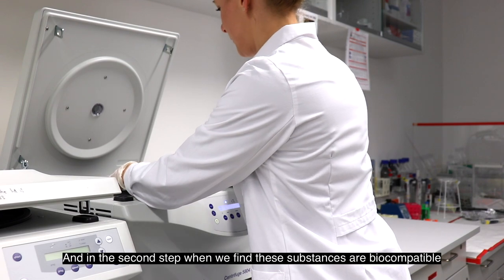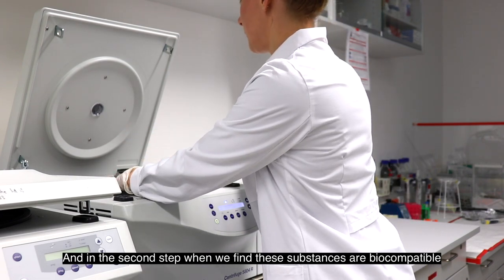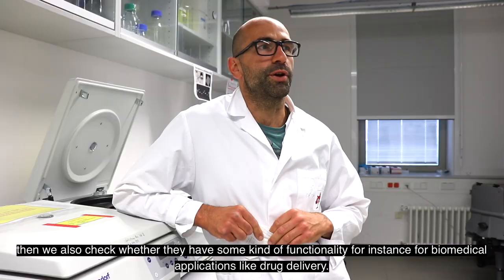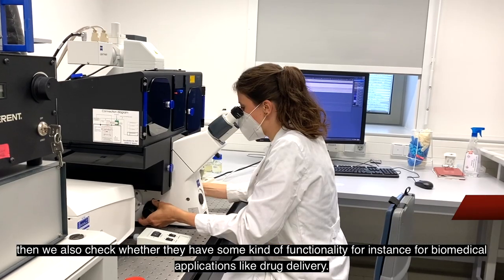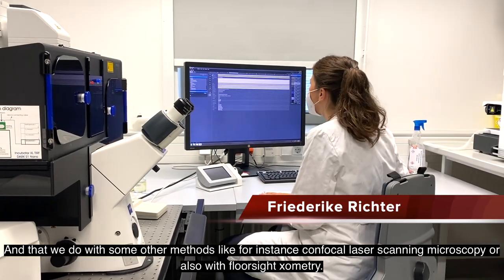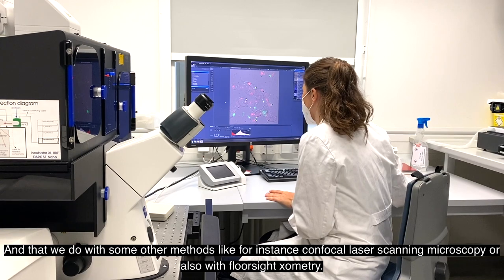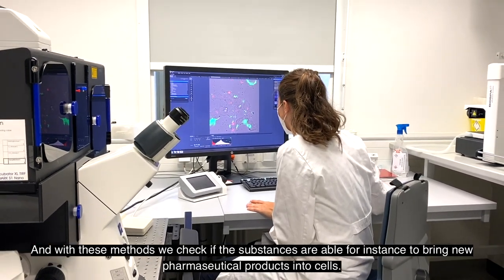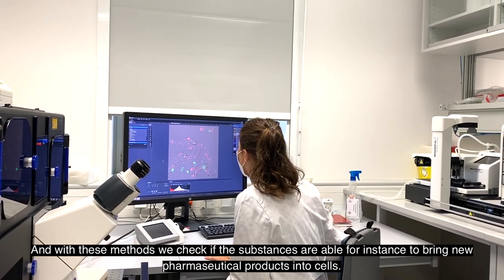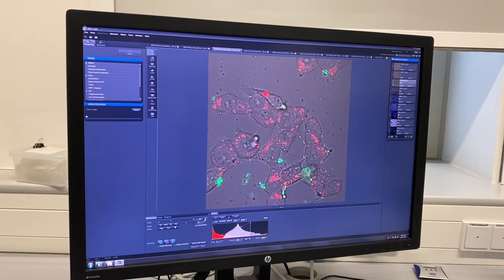In the second step, when we find out these substances are biocompatible — since we normally aim at biocompatible substances — we also check whether they have some functionality. For instance, for biomedical applications like drug delivery, we use methods like confocal laser scanning microscopy or flow cytometry to check if these substances are able to bring new pharmaceutical products into cells.